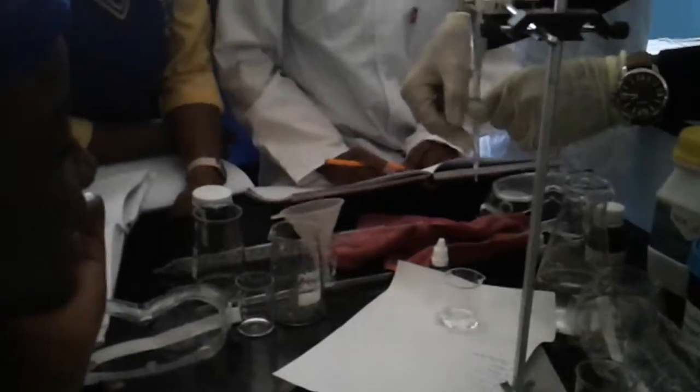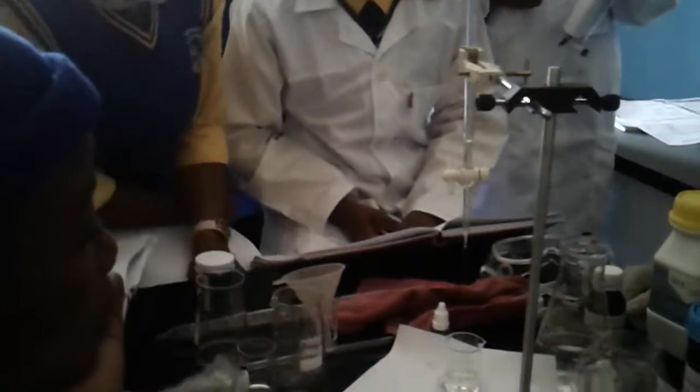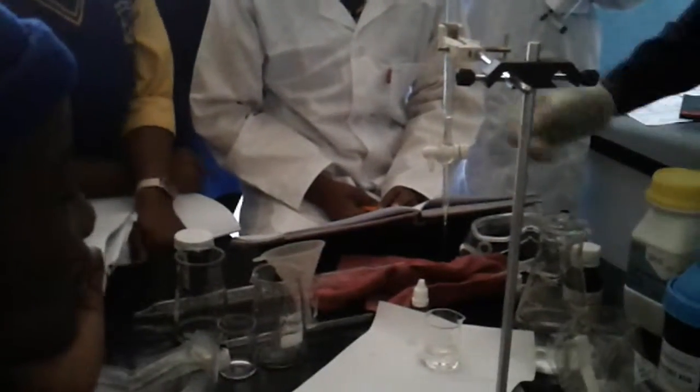It is not, guys. Even sometimes when people use the pipette, they miss. Serious, guys, people do miss. They miss the white tile.